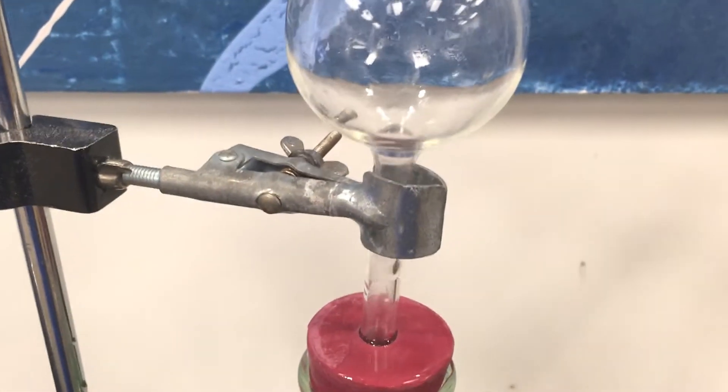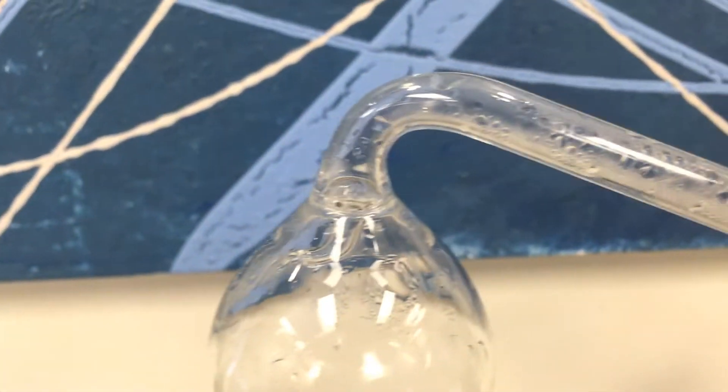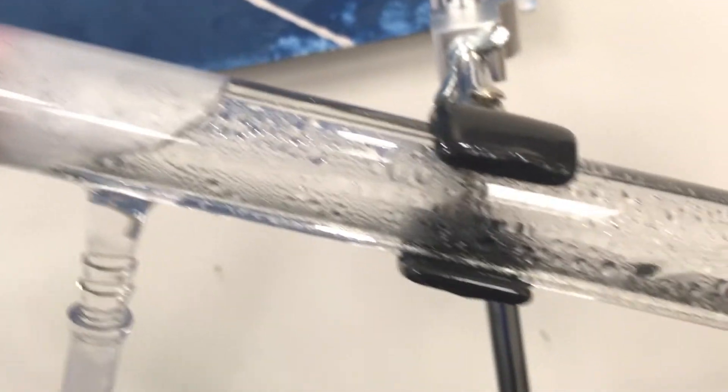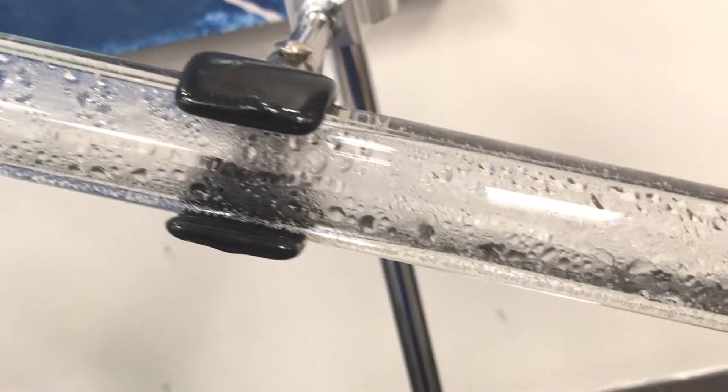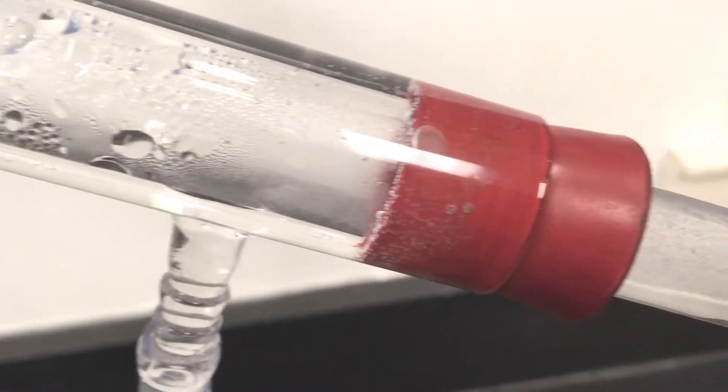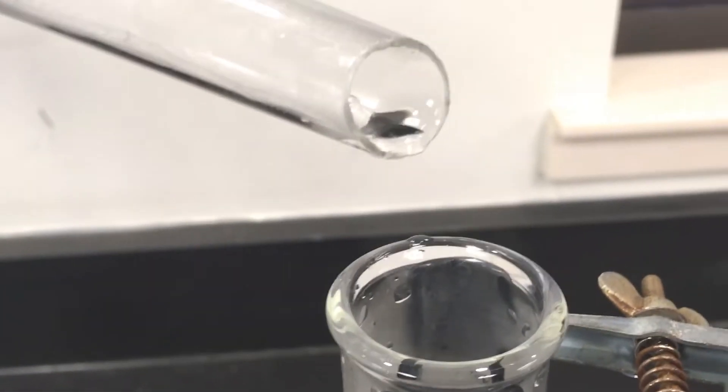All right, there's quite a bit of stuff going on now. We've got this bubbling here. We actually have it condensing a little bit here. We move down to the condenser and here's what's happening. We're condensing inside. There's a tube inside that water jacket where it's condensing and we have liquid flowing down. And let's take a look at what the liquid is. The liquid looks like it is perfectly clear.